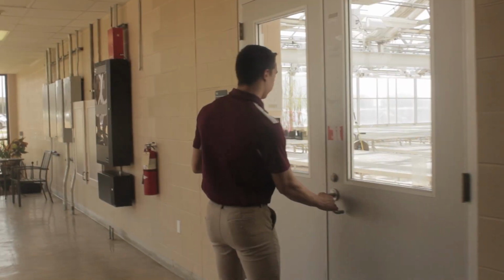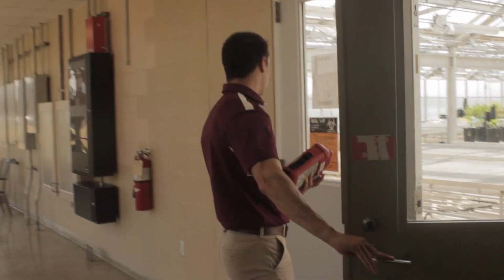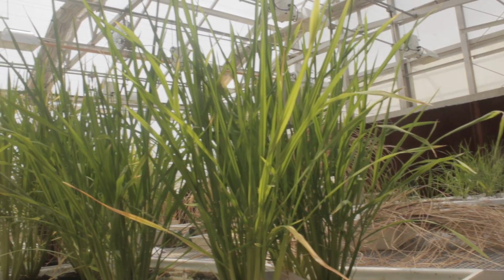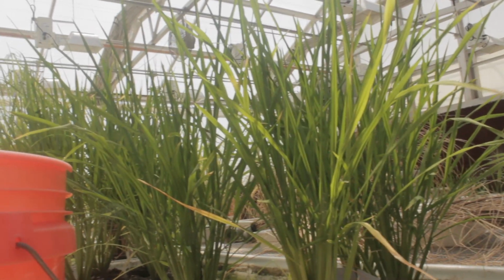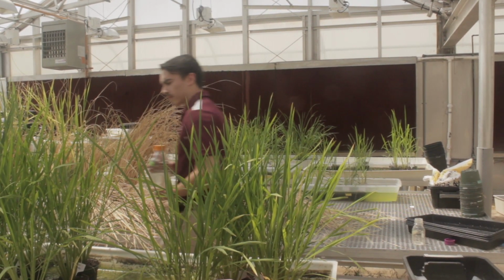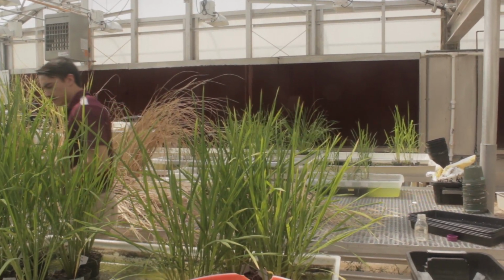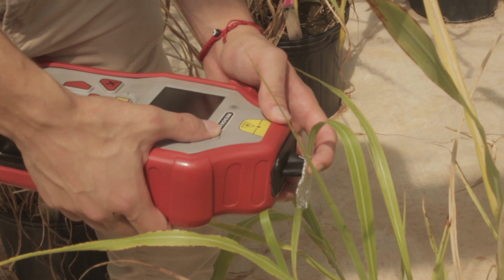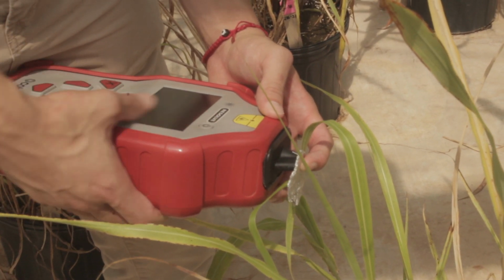Involving myself in different fields of study, it's important to connect these fields together. With the growth of the human population, food demand will increase by 30% in under 30 years. Furthermore, anywhere between 30 to 40% of crops are lost annually due to pests and environmental stressors. Therefore, protection of our crops is of vital importance to maintaining both the global economy and ensuring there's enough food for everyone. We propose to tackle this issue with Raman spectroscopy.